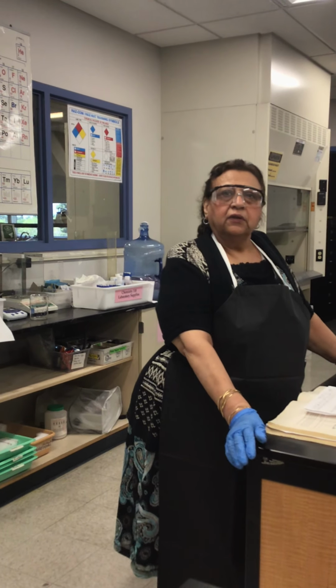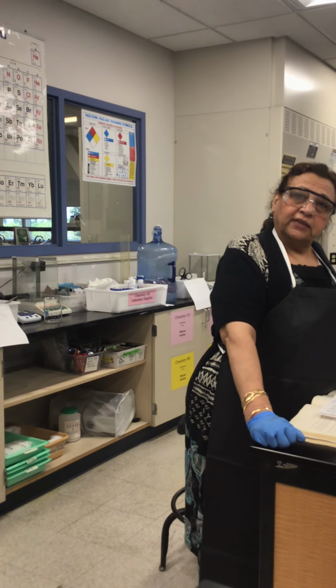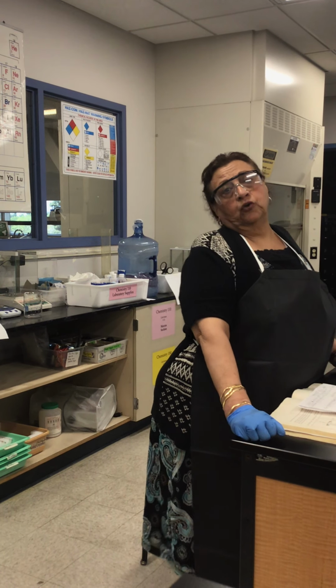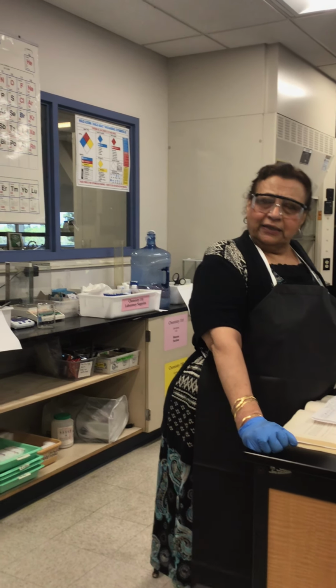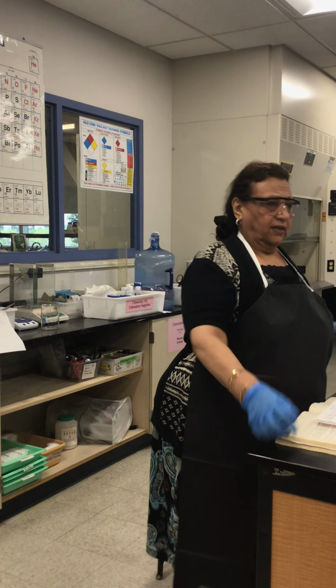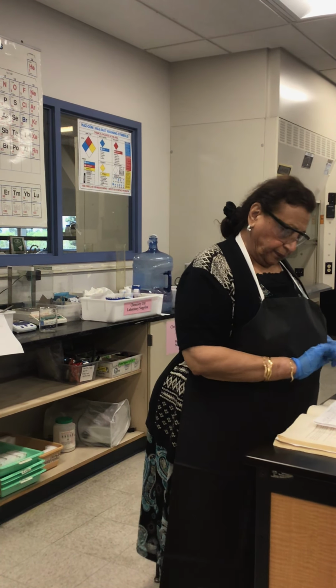First of all, it is cheap and it has a low tendency of supercooling. It also has a low melting point, about 43 degrees Celsius, so the thermometer we have here can measure that temperature.